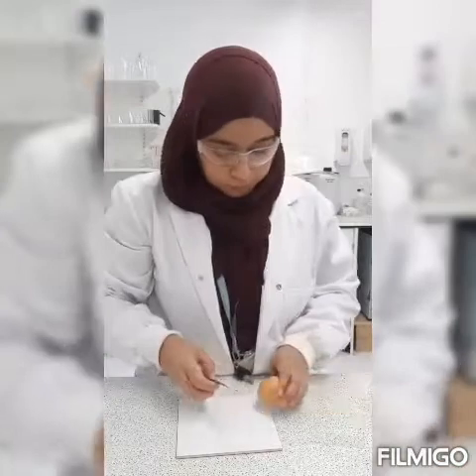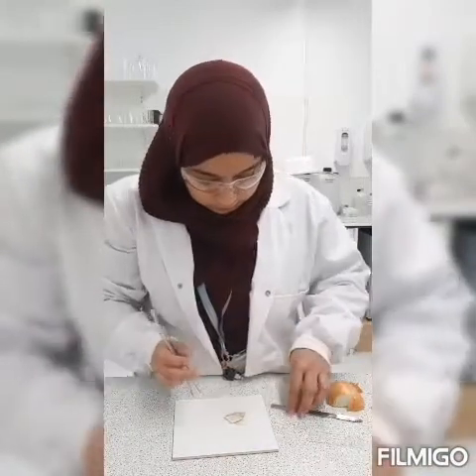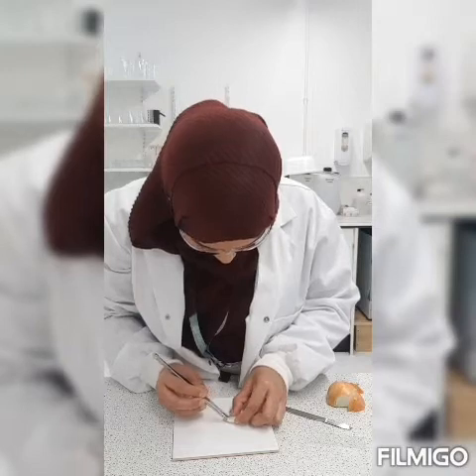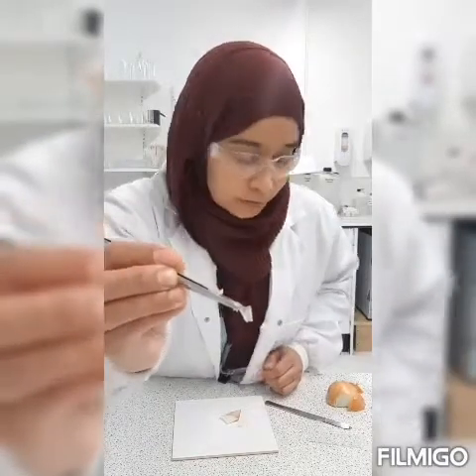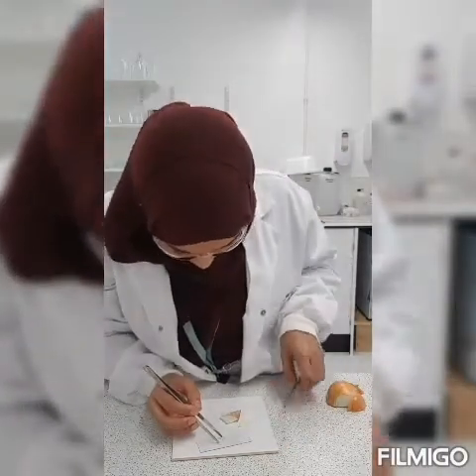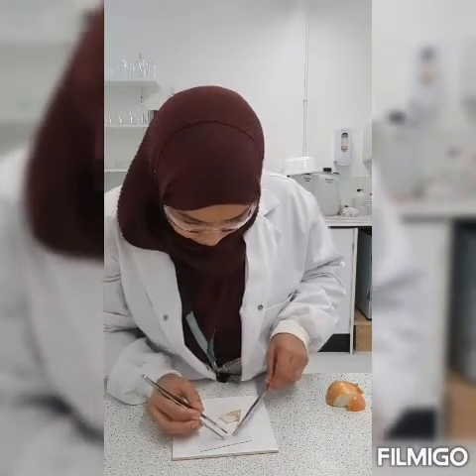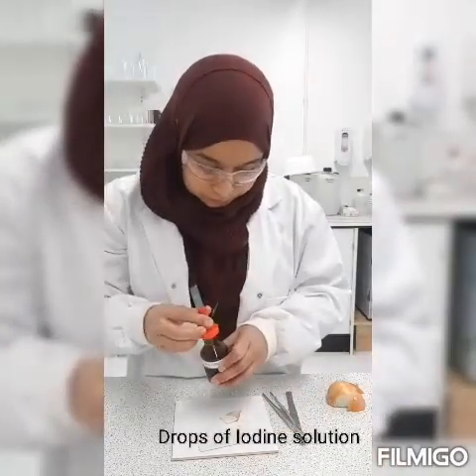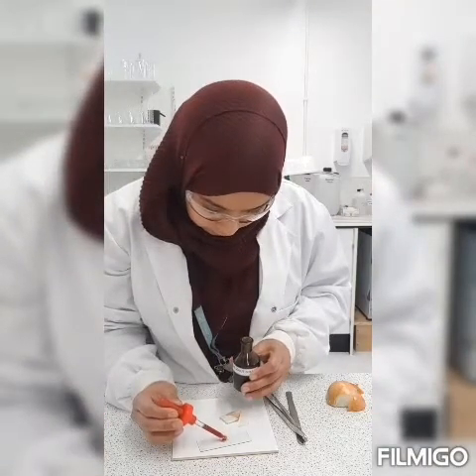First things first, put my goggles on. Then I'm going to slice a small piece of onion and extract the thin layer of cells. As you can see there, I'm going to place that on my microscope slide, flatten it out, and then put a couple of drops of iodine solution. This will stain the starch in the cells, and then you can see it more clearly under the microscope.